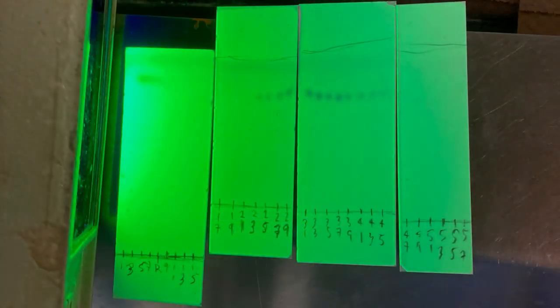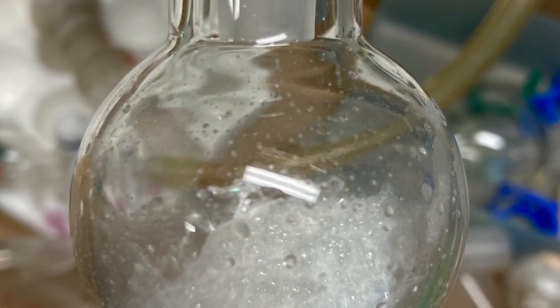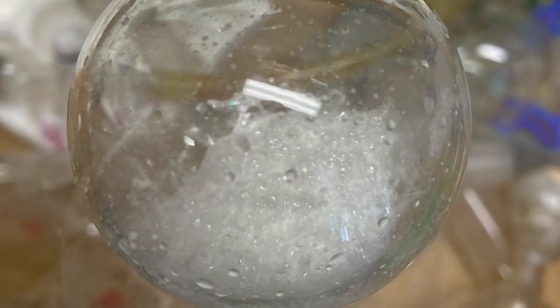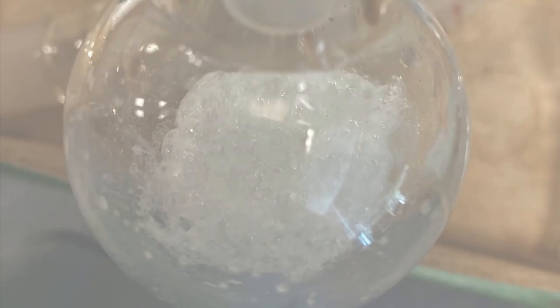The fractions containing the desired compound are then pooled together by transferring to a round bottom flask. The solvent is evaporated using a rotary evaporator followed by a high vacuum which concentrates and dries the sample prior to mass determination for yields.